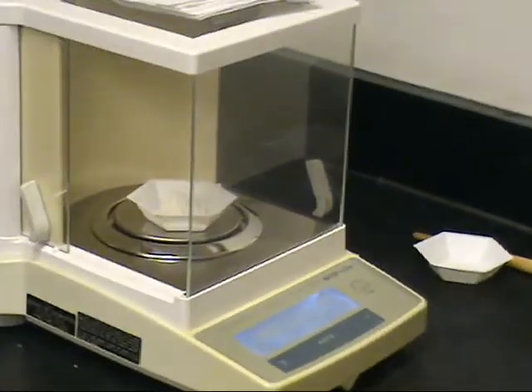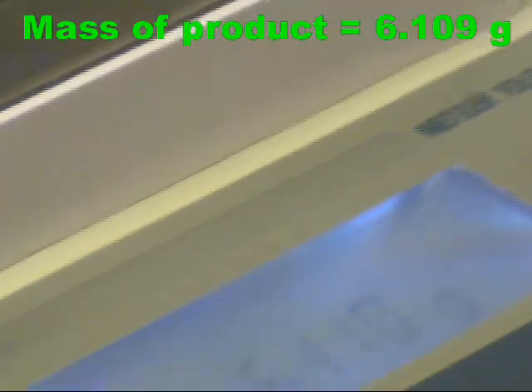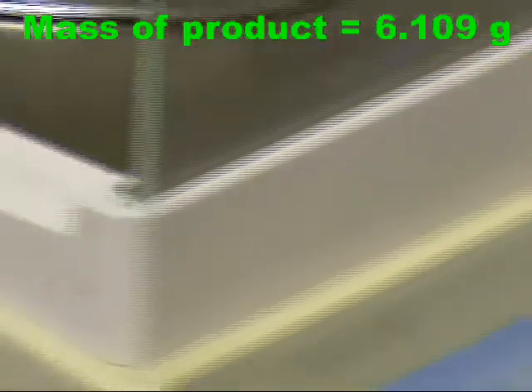Last, the product is weighed. The final product is a white crystalline solid. As you can see, 6.109 grams of product are recovered.